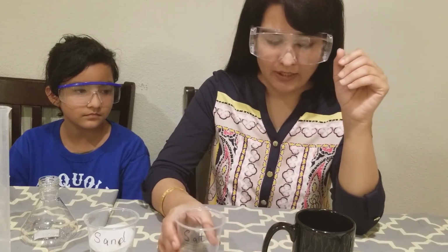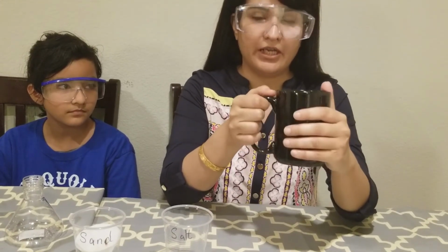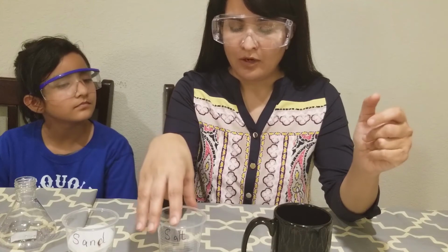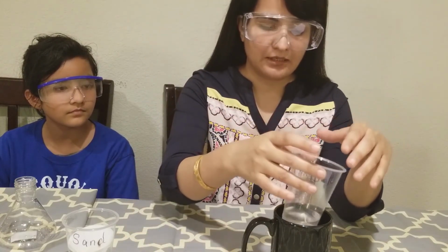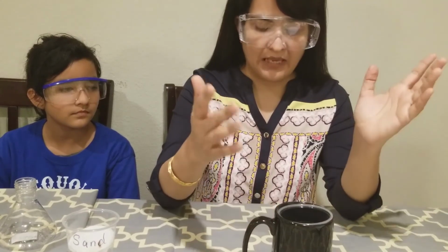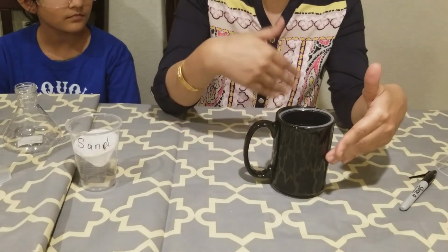So in order to do that, what I will do is I have this cup, half filled water, and I have heated this water in a microwave. And this water, I heat it like a couple of times so that the water is boiling right now. What I will do is I will put my salt solution in this cup in the boiling water, and I'm gonna leave it there, and the heat from this boiling water will go in the salt solution, and it will slowly start evaporating.